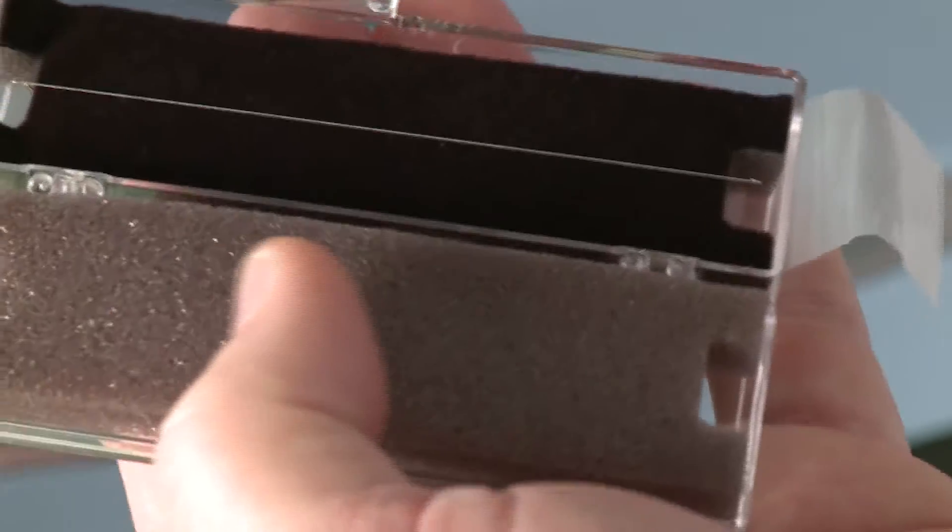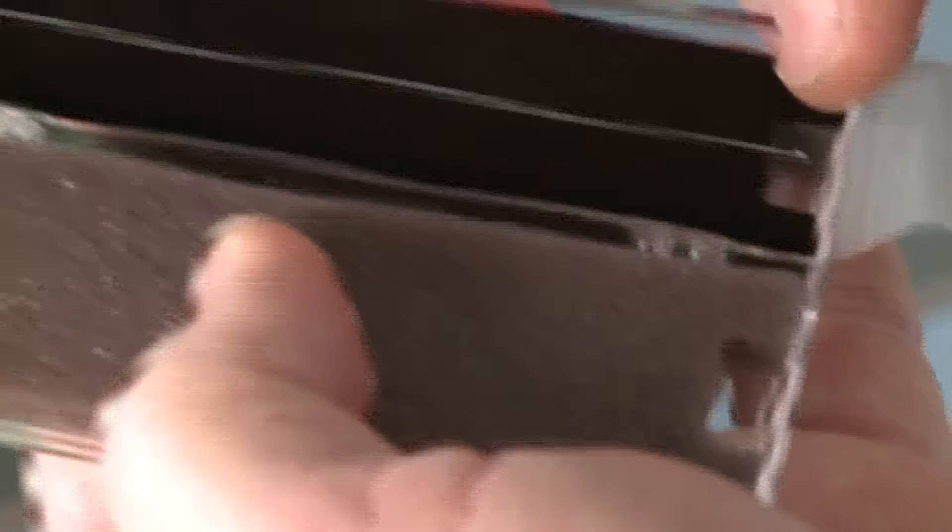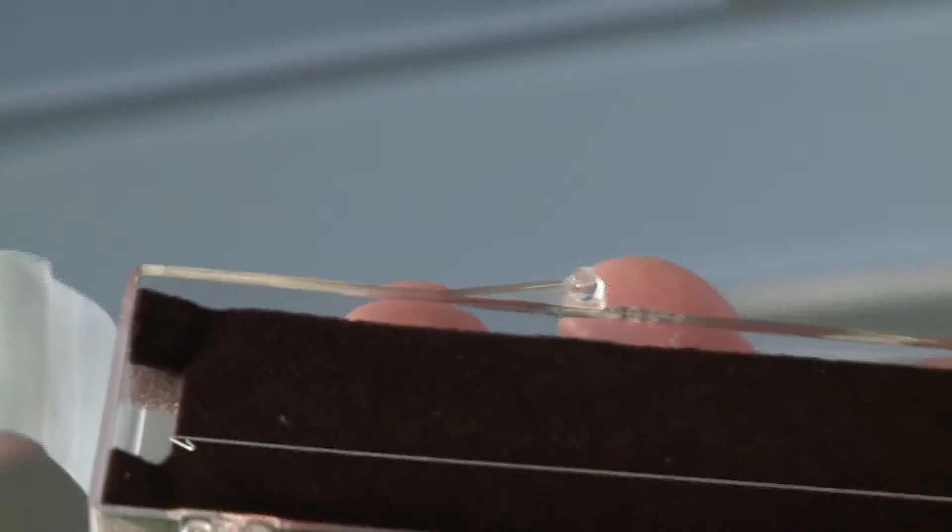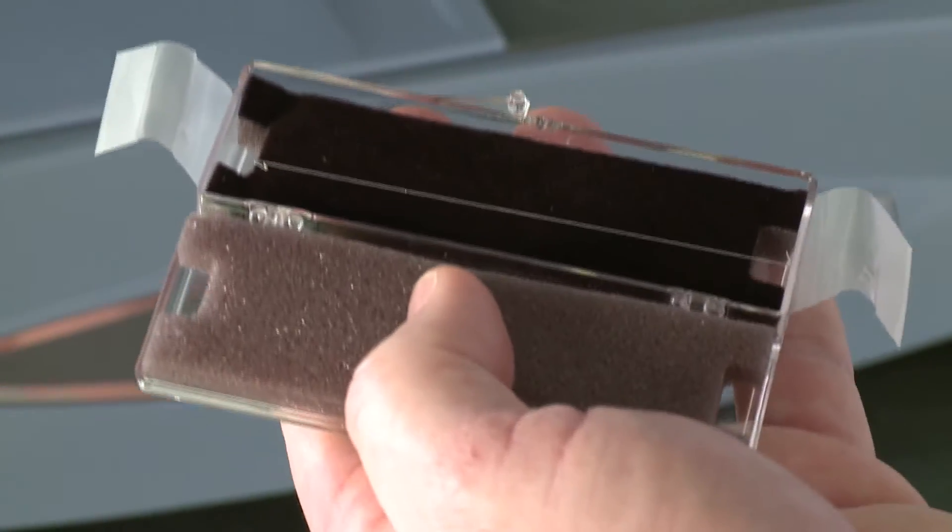Putting the new hang down wire in is basically the reverse of the process. So, we have our new hang down wire. One side of the hang down wire has a single loop to it and that's for our pan. The other side has a double loop. That's the bit we're going to hang to the top of our balance.